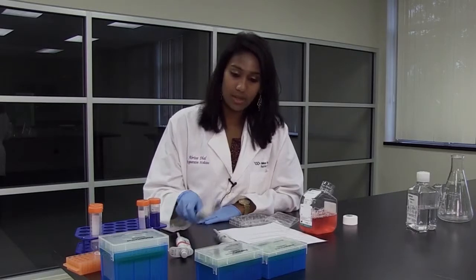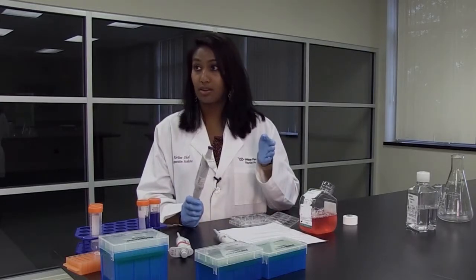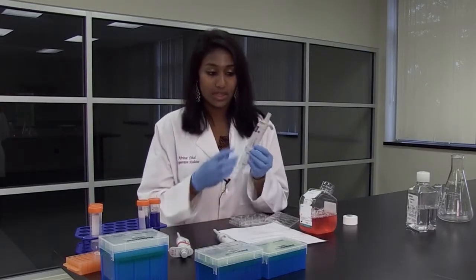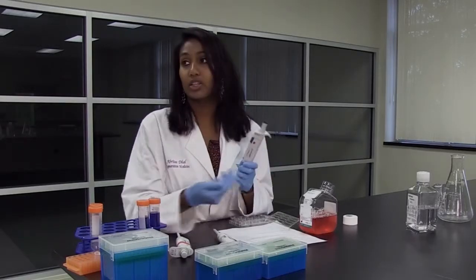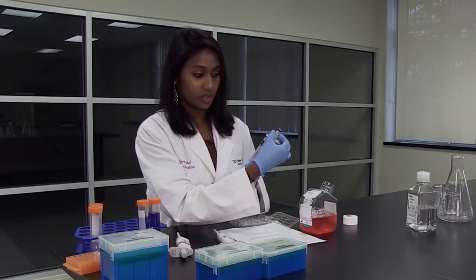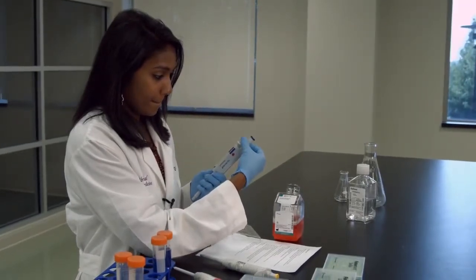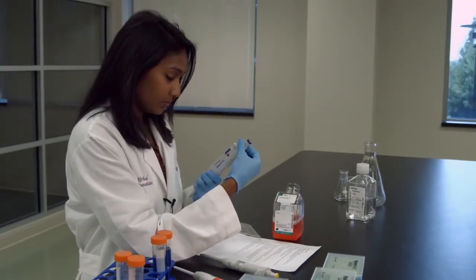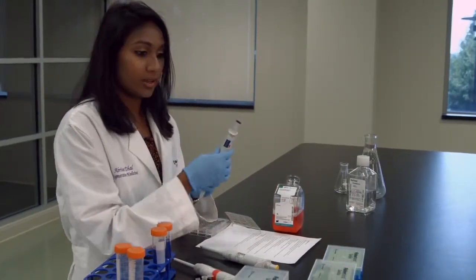To set the micropipette — with the P1000, it ranges from anywhere from 100 microliters to 1,000 microliters. We see these digits on the side, and to set it, if we want to do 800 microliters, we twist the knob at the top to 800 microliters.